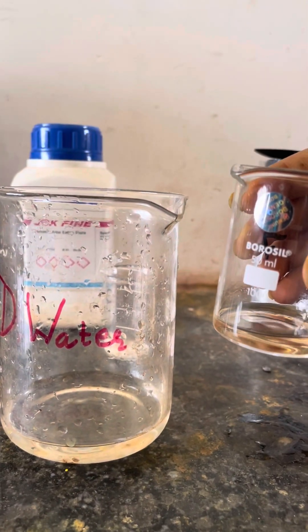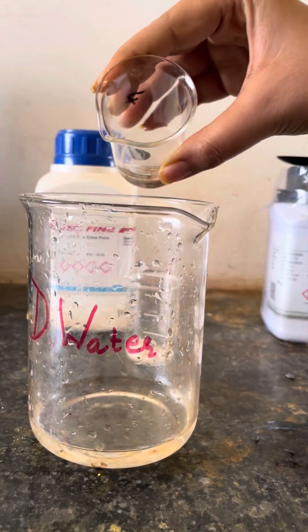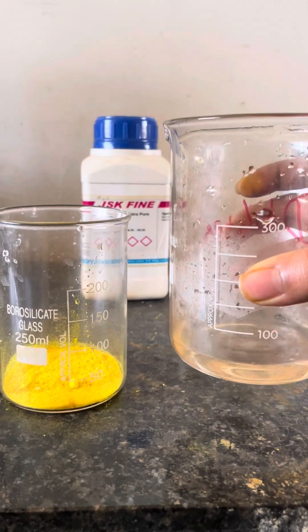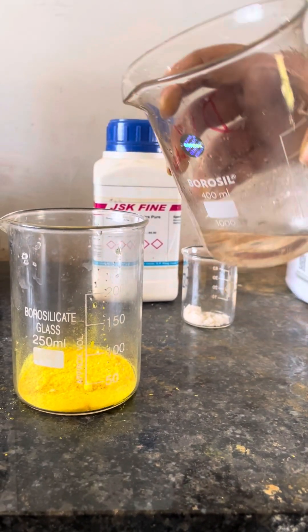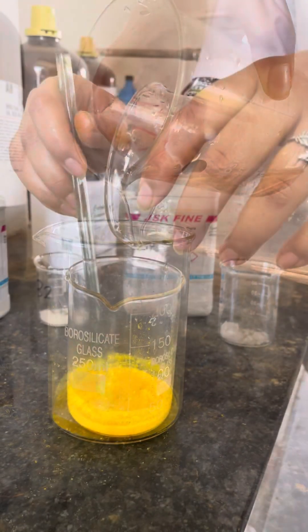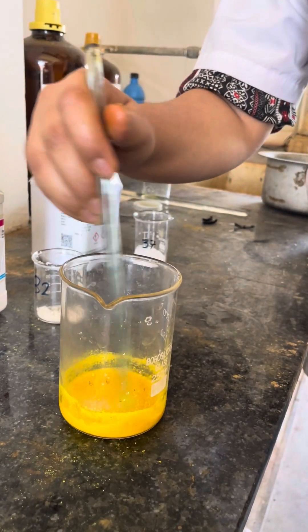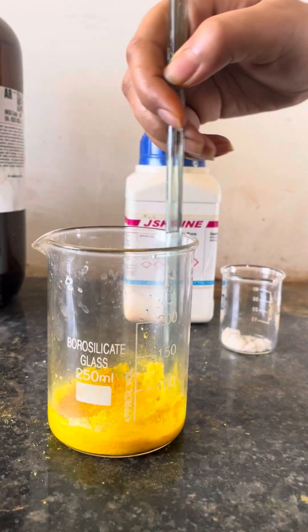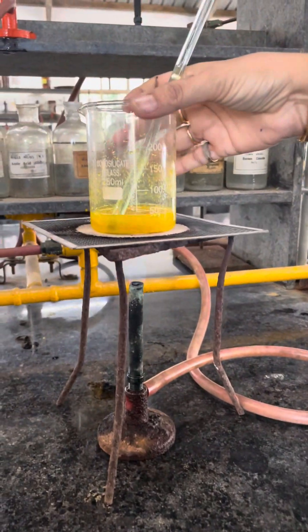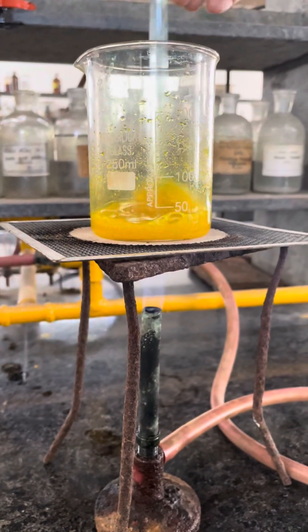In another beaker, take 30ml distilled water and add 7.5g concentrated H2SO4. Now add the concentrated H2SO4 and water mixture to the para-nitroaniline by continuous stirring. Para-nitroaniline is not dissolved in concentrated H2SO4, so heat the mixture for 2-3 minutes to get a clear solution.